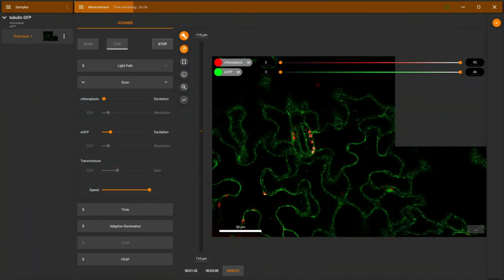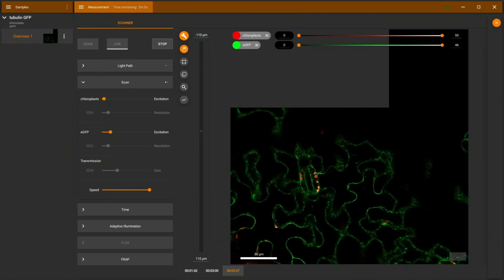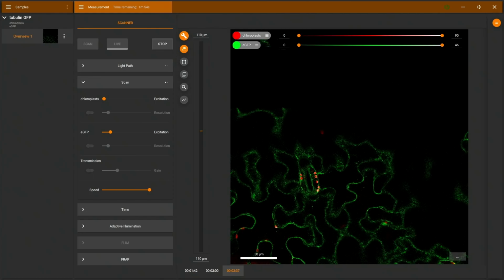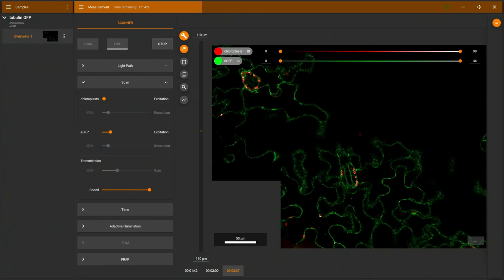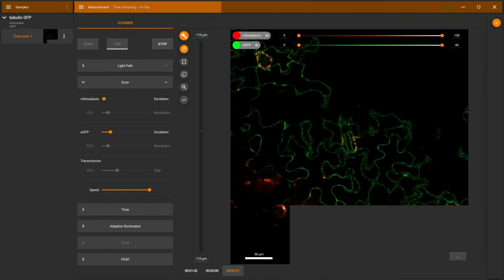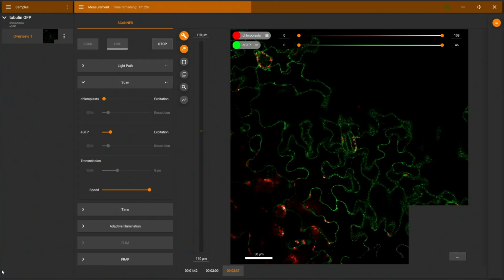And now I'm moving, as I say, in a spiral pattern around with the stage to explore the area. And that can be really helpful to get a nice large overview and then pick areas which might be biologically relevant or interesting. And we can nicely zoom into these areas later on. So if you, for example, want to have a coffee break, you could leave this running for a long time and then pick and choose your interesting areas from a large overview. And I will stop this scan a little bit earlier than the defined large range. So I can stop this at any point, just for time reasons here. There we go.